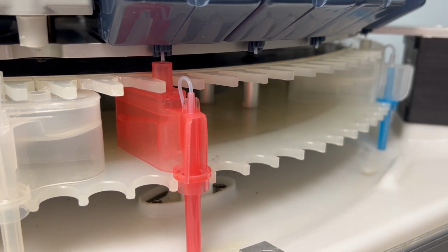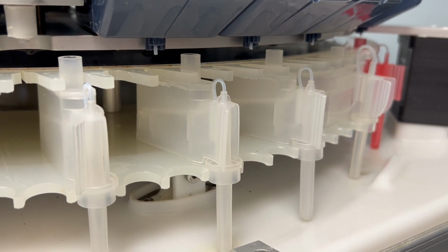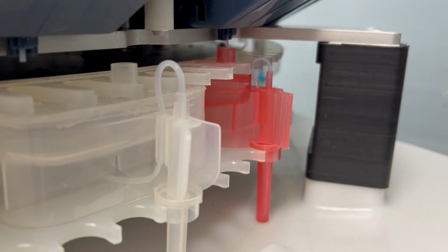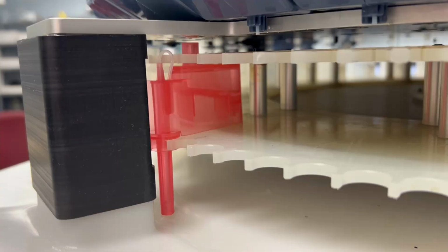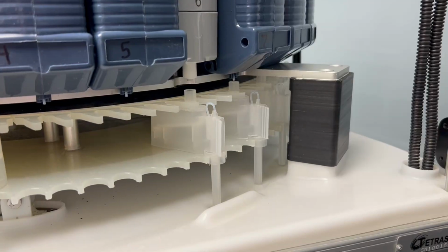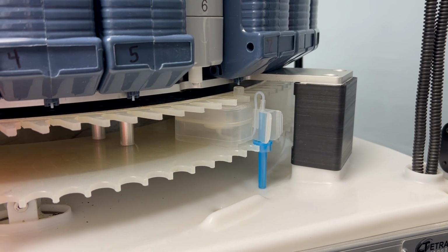Now, all of this sounds great in theory, but you're watching a pre-recorded demo with a pre-scripted protocol from our team. Everything's going to go right. Where TETRAS truly stands out is when things don't go as planned. So, let's put that to the test. We're going to crash TETRAS and show how its modular design takes versatility to the next level for our users.